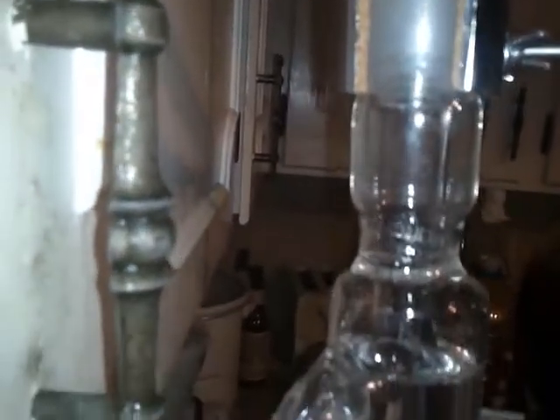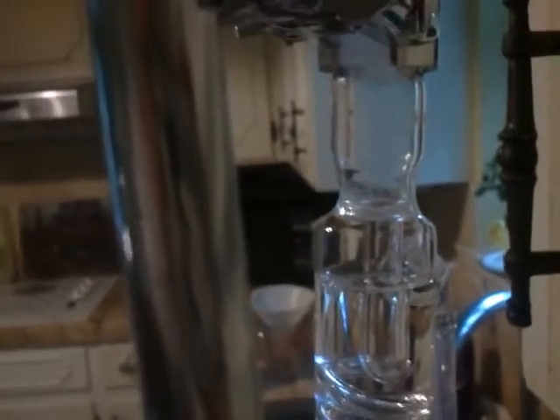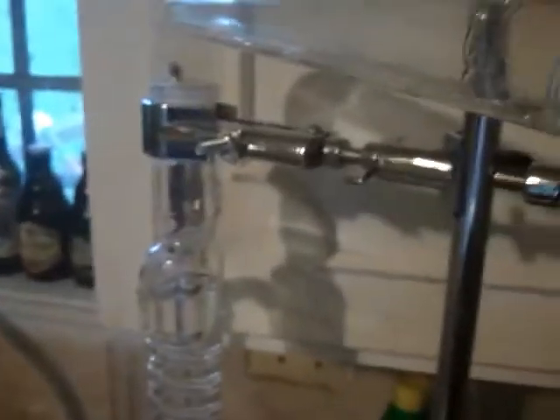We've been running for a little while now and we're getting really heavy condensation on the inside. Our lawnmower fuel is coming along nicely. I've been collecting distillate for about a half hour now — slowly dripping.